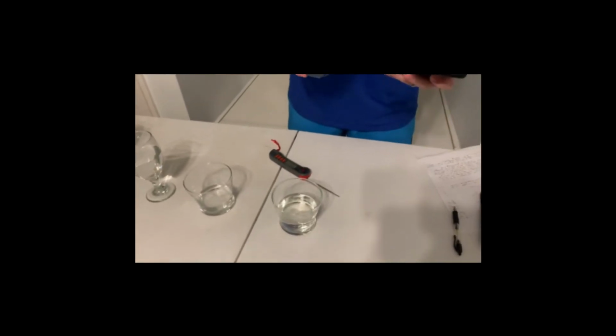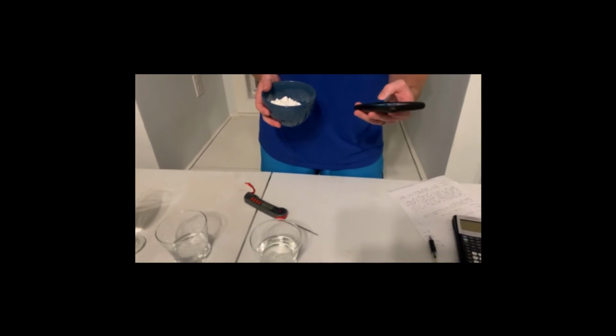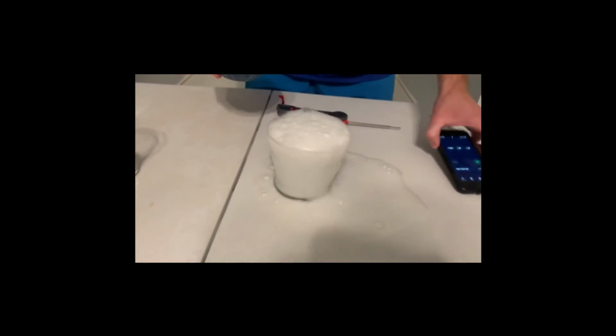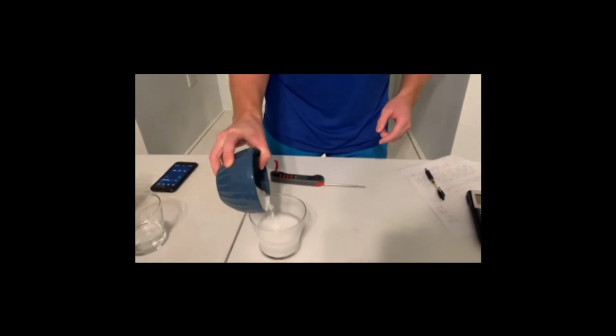Now this reaction will give some cool visuals for us to see. I'm going to also get my timer and set that. Whoops. Joys of phones. There we go. All right. Check this out. Oh, we got bubbles. All right. Well, we had a little bit of an explosion, a little bit of a mess. That's why we wear safety goggles, just in case something happens. So I'm going to get the rest of my baking soda in here.